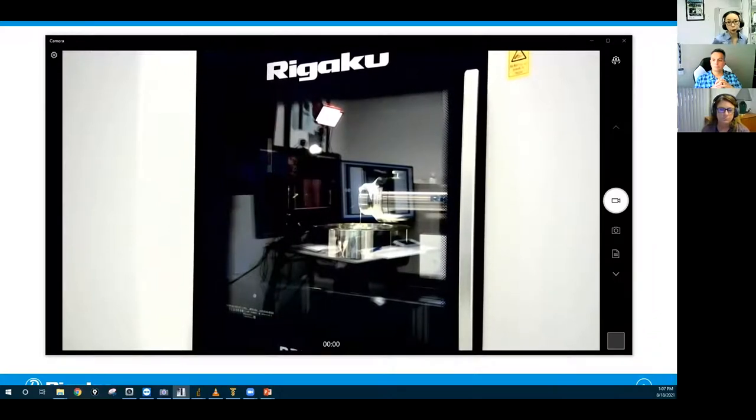And in part one, we had molybdenum 17 keV target or radiation. So today, just for change, we're gonna use copper anode. So we have 8 keV X-ray energy. And as far as the lens goes, we have 20x lens. So the voxel size, if you don't do any binning on it, is about a quarter of a micron voxel size or voxel resolution. So keep that in mind when we ask you to choose the measurement conditions we should be using. Okay. With that said, let's look at the first sample.